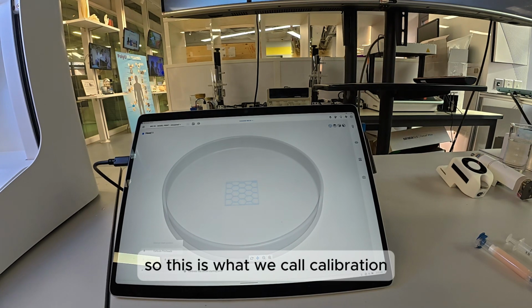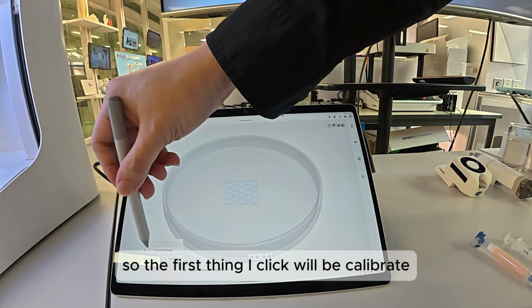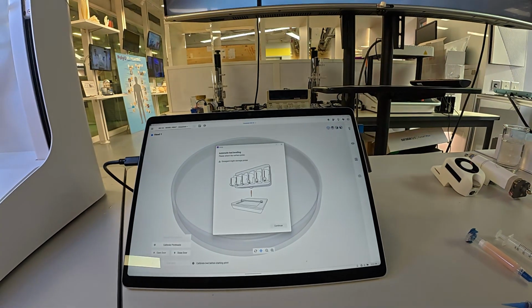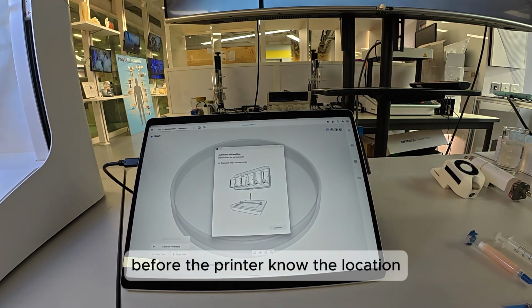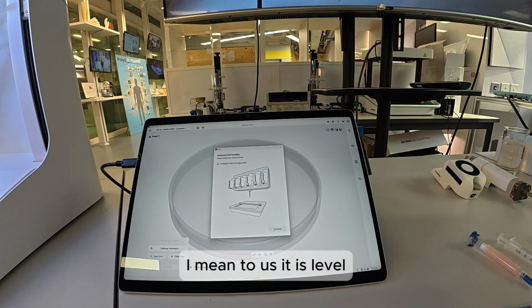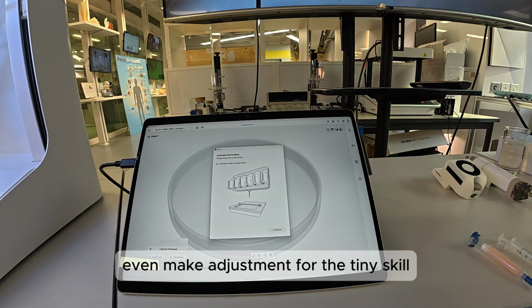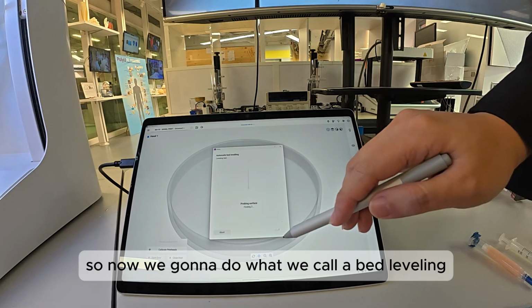So this is what we call calibration. You have to calibrate the printer. So the first thing I click will be calibrate. And then I click on automatic bed leveling. Alright. So before the printer knows the location, the printer wants to make sure that it can give you a good printing, a fine printing. So it needs to make sure that the stage is level. I mean, to us, it is level, but to the printer, it needs to even make adjustment for the tiny scale. So now we're gonna do what we call bed leveling.